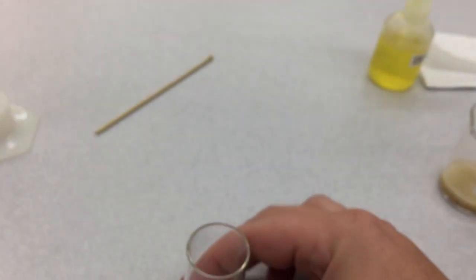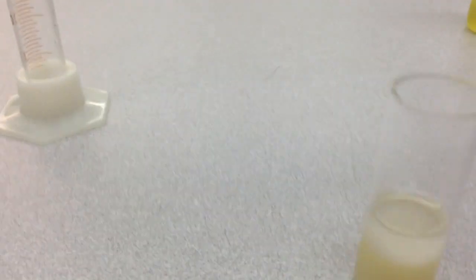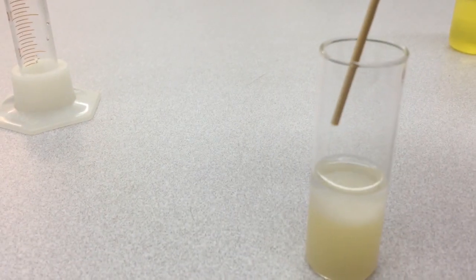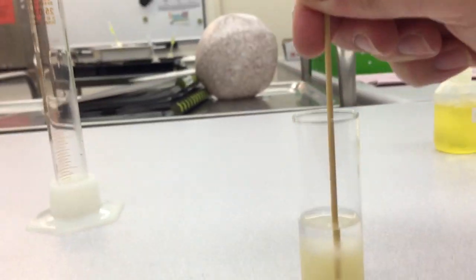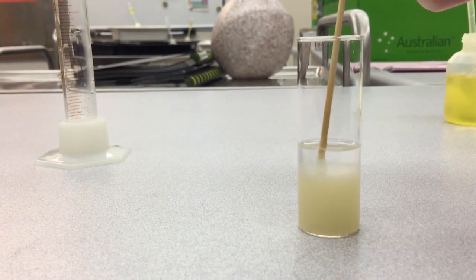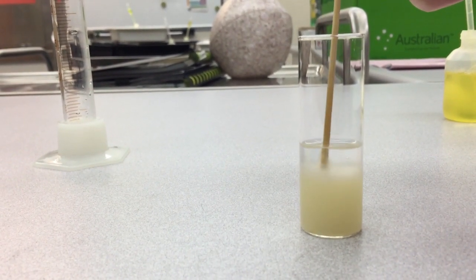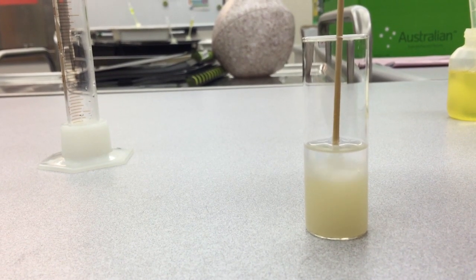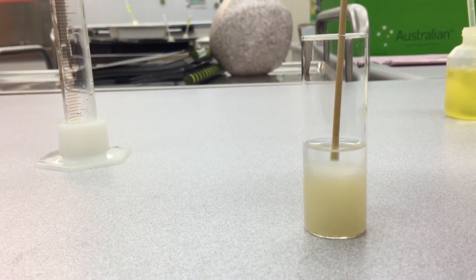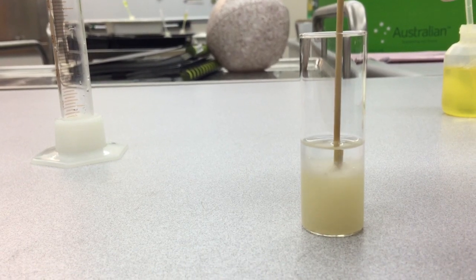We can then come across and have a little bit of a play with that DNA. We can actually sort of mix it around, lift up little strands of it, and you can sort of see it's that kind of slightly gooey, filmy kind of consistency.